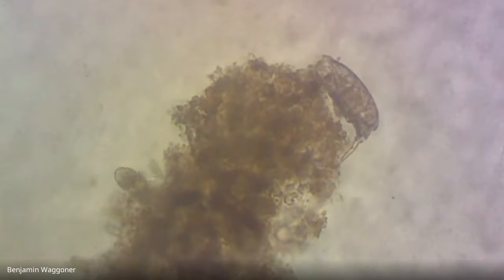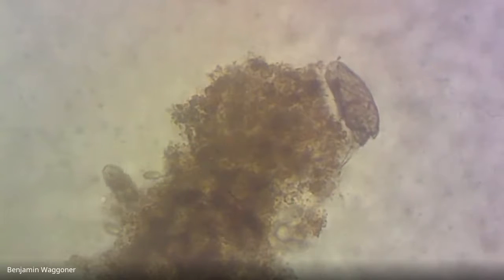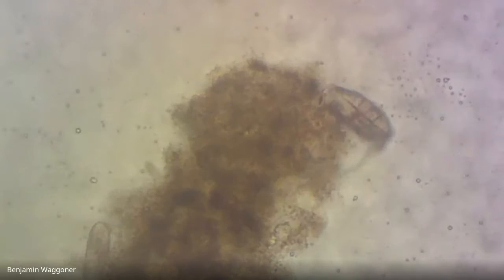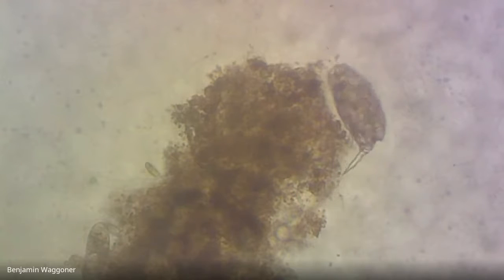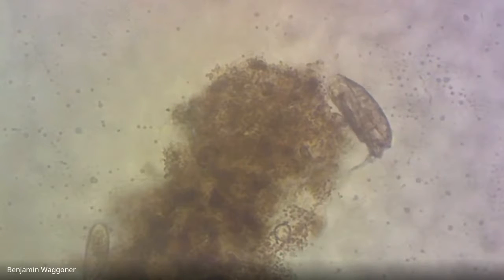Ooh, this is interesting. Okay, let's zoom in on here and see if I can get a shot of her. Okay, there are some ciliates that are grazing. There's one that I'm seeing right now at about the 3 o'clock position, but over at about the 10 o'clock, there's something that's about the size of a ciliate, but it looks like it's got a long tail, and it looks like it's almost got a jointed appearance to the tail. You can see that tail's made up of several joints. That's actually an animal. That's a multicelled critter.